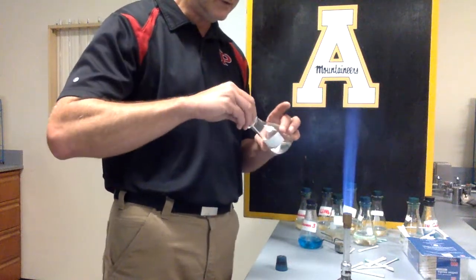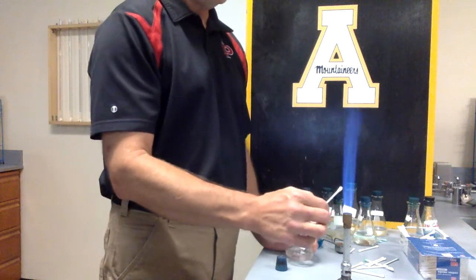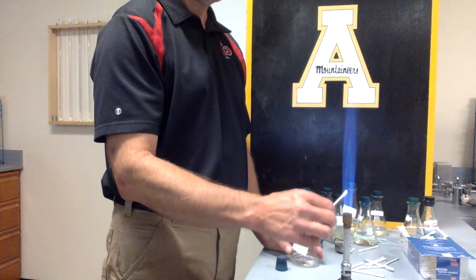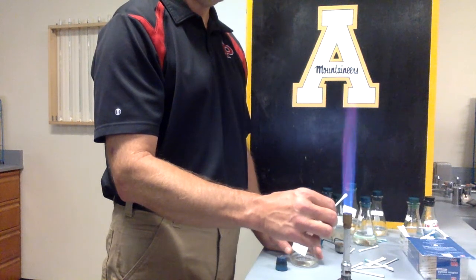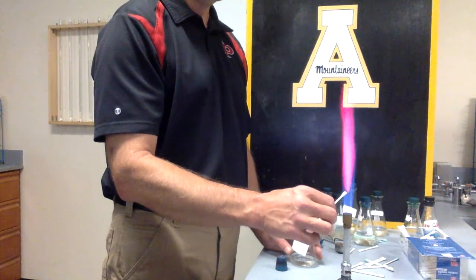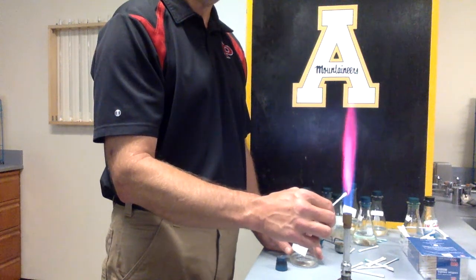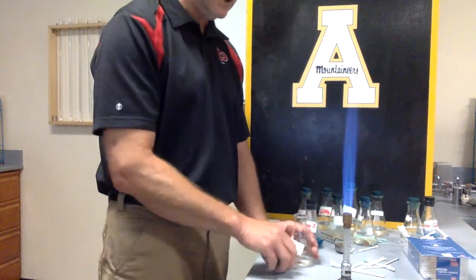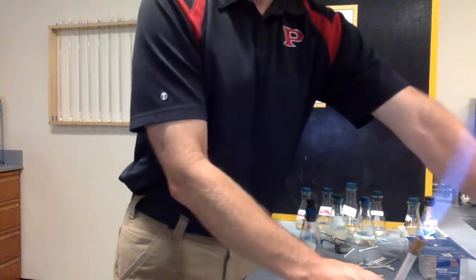This is unknown 2. So if you need to retype that, you can. So this is our unknown 2. Oh yeah, almost. Wow, look at that. That's that real dark pink. We had one that was lighter, and we had one that was like, bam, a dark pink. And that would definitely be the one that's the darker of the pinks. So I'm going to go ahead and turn this off.